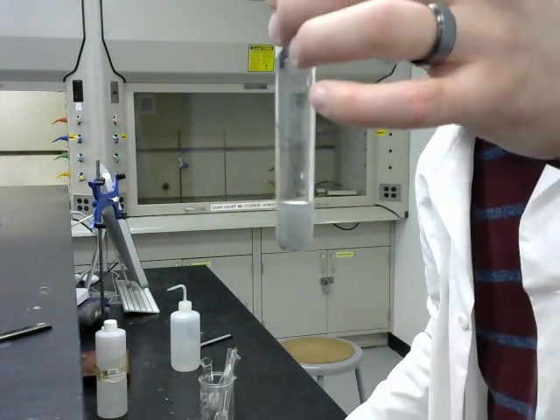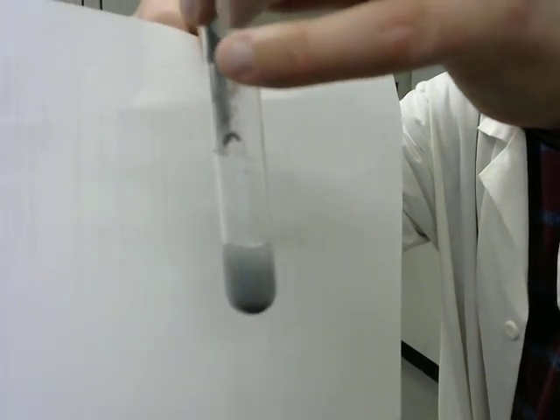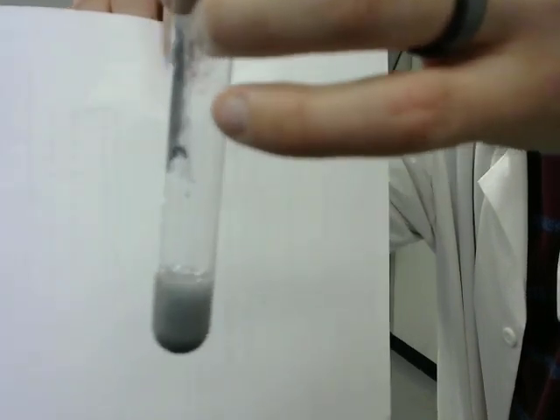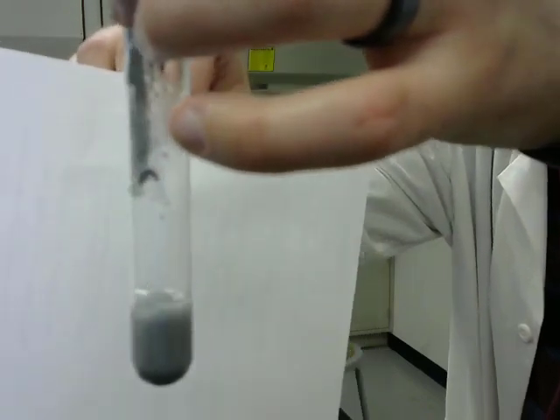It's certainly producing bubbles. There we go, now it's getting started. Maybe there was something that was preventing it from reacting, but now it's making bubbles at a good rate. So that is the chromium. It's reacting a bit more vigorously than the iron even, and now it really legitimately is. Oops, wrong way.